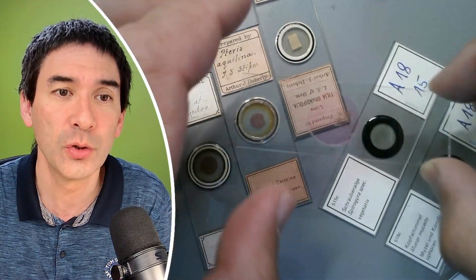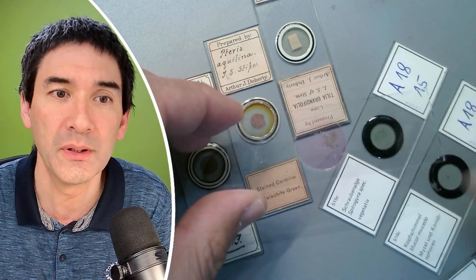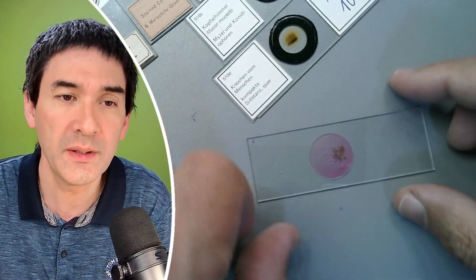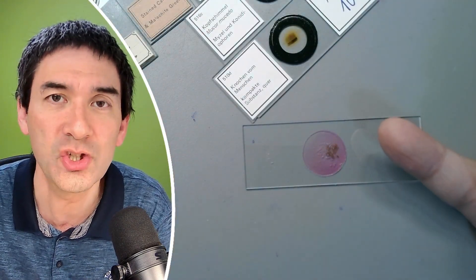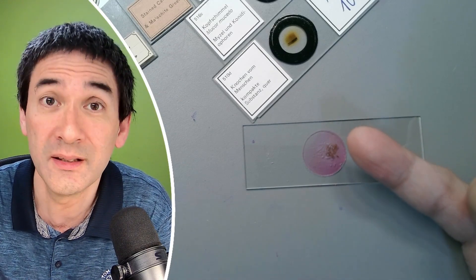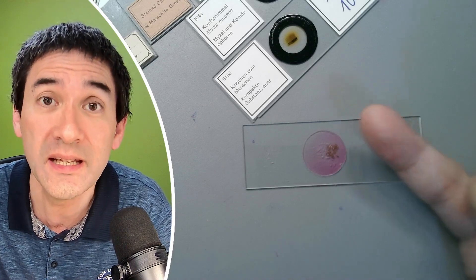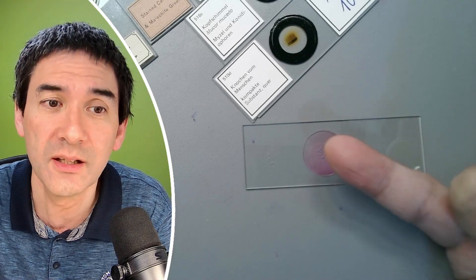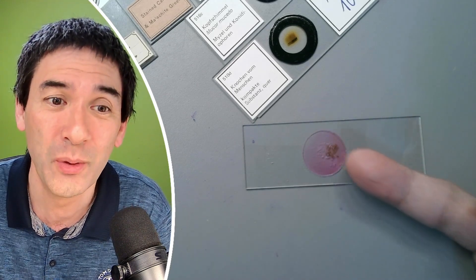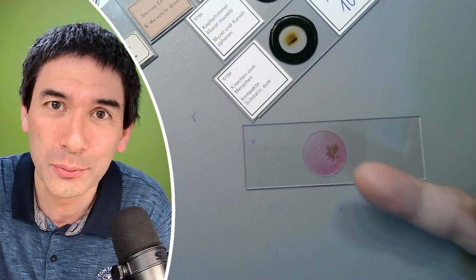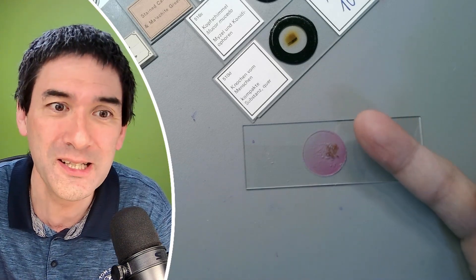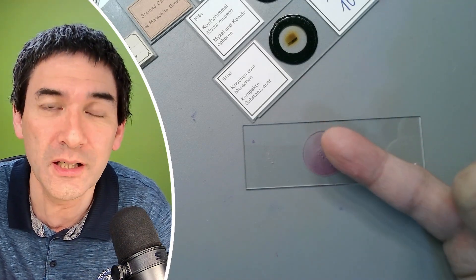I just want to show you over here. This slide here is not ringed. It's a pond water sample. There's some algae on here. And the mounting medium that I used here, it does not turn completely solid. It's called glycerin gelatin. So it's actually semi-solid. It's like a thick gel. And it does not dry out, but it maintains moist. And for this reason, it's still flexible, right? And the cover glass, even though it sticks on the slide, doesn't stick very tightly. So if I want to take my fingernail, I could actually lift off and pry off the cover glass again.